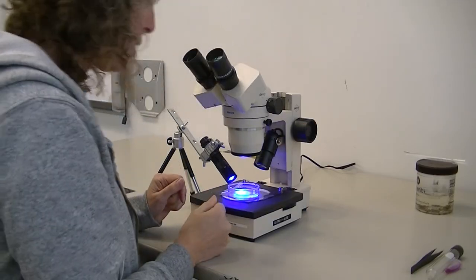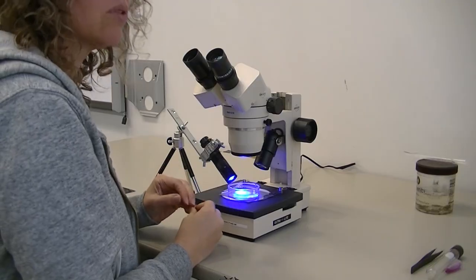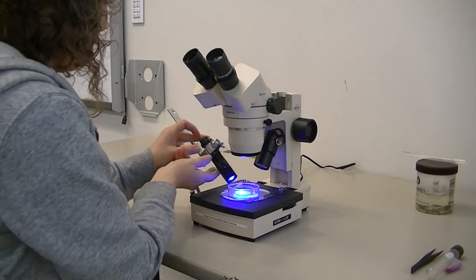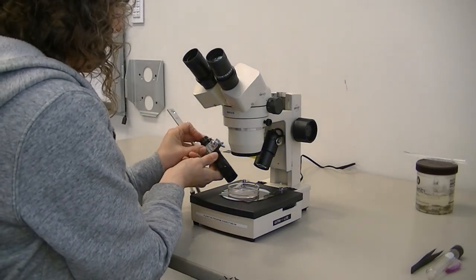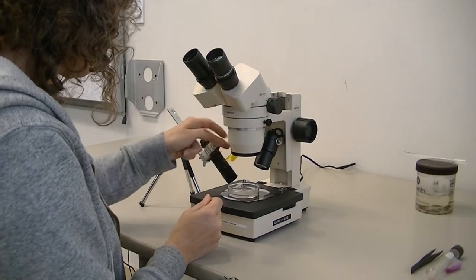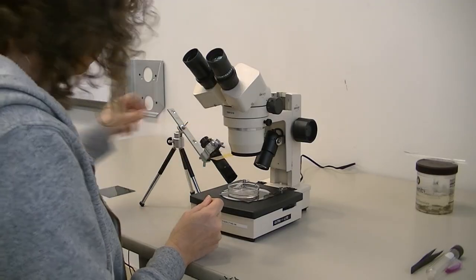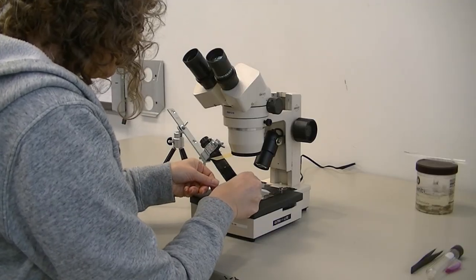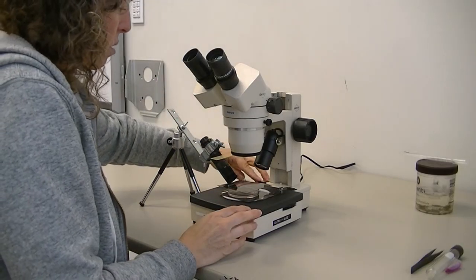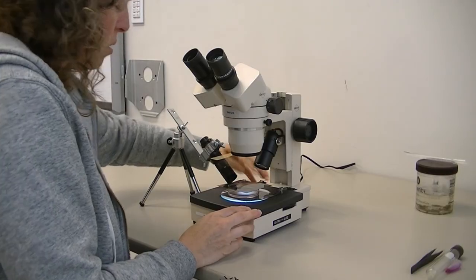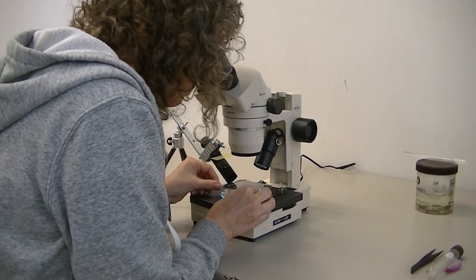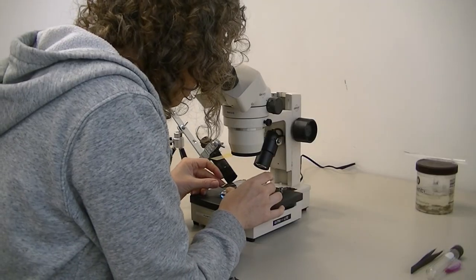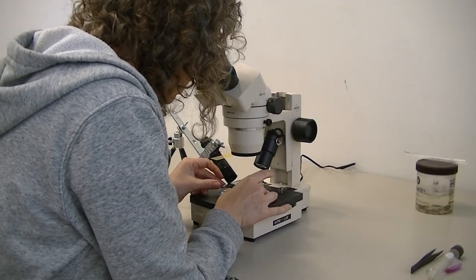To double-check that it's the plastic, I will use the polarizing technique. I'll switch from the blue light, move my yellow filter out of the way, place my second polarizing lens on top, film on top, turn the bottom light on, and look for the bright polarized light.